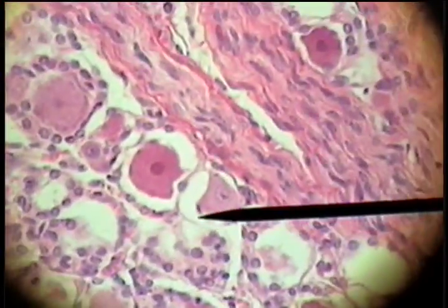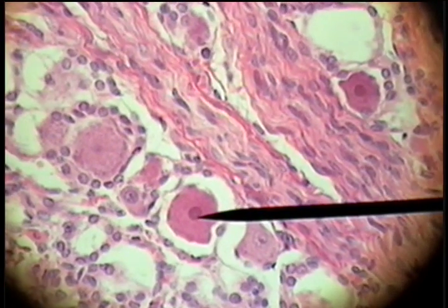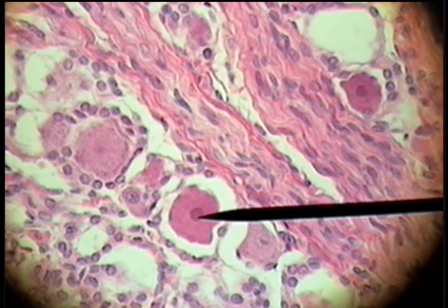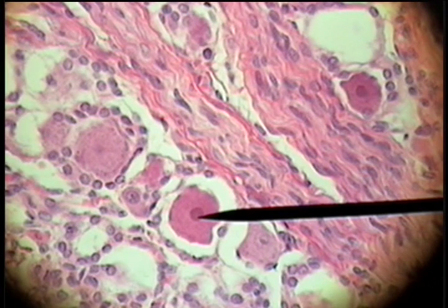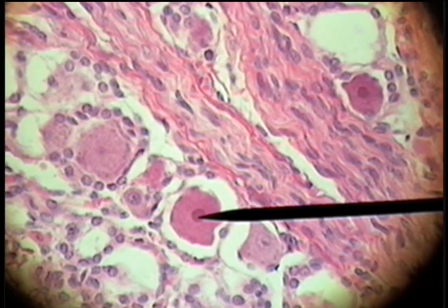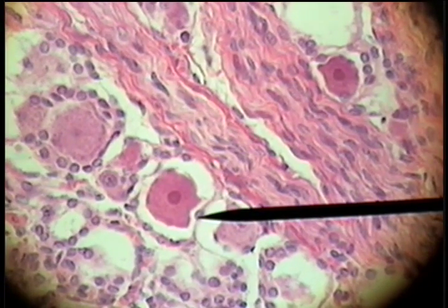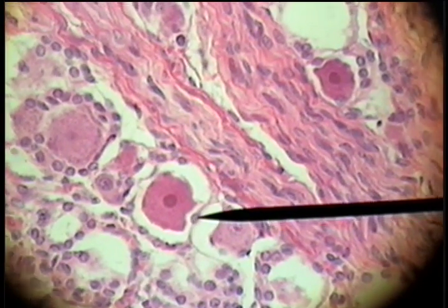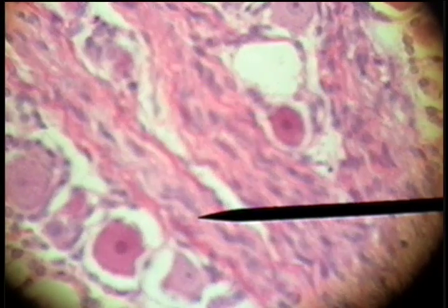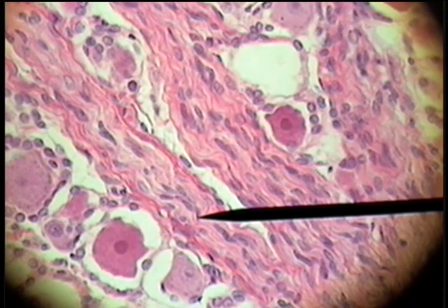Let's see if we can find another owl eye neuron. There's a good one right there — the nerve cell body of the sensory dorsal root ganglion cells, and here's the capsule cell found on the exterior.